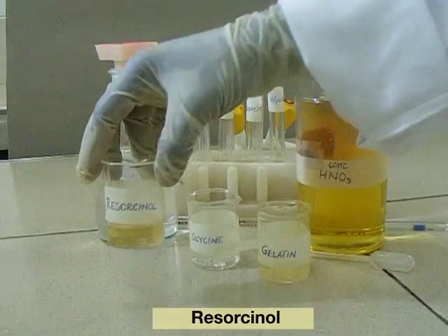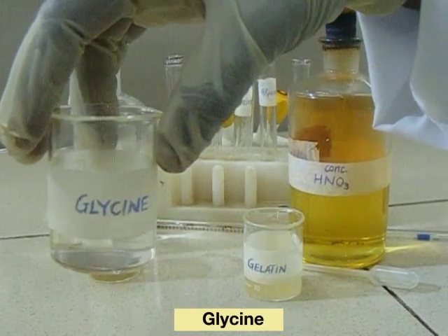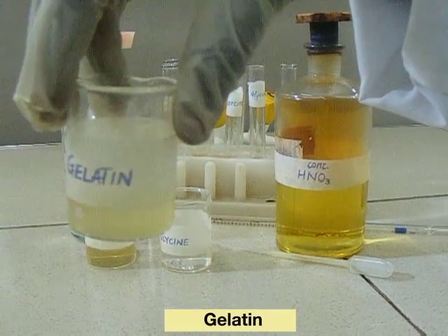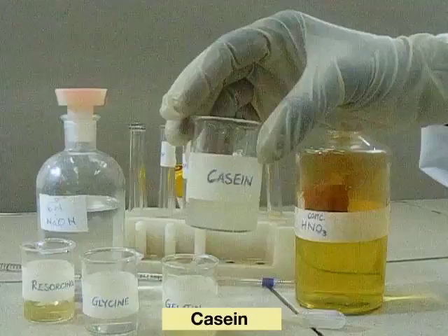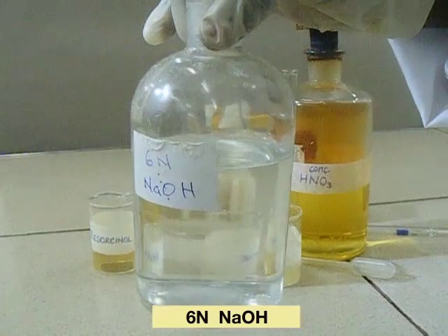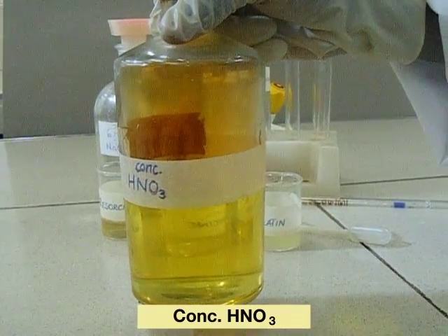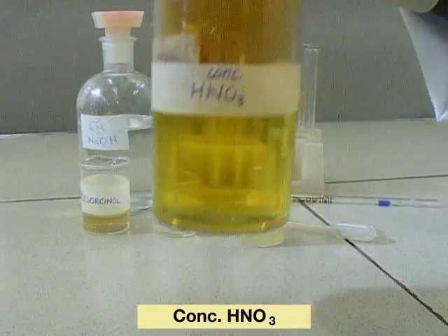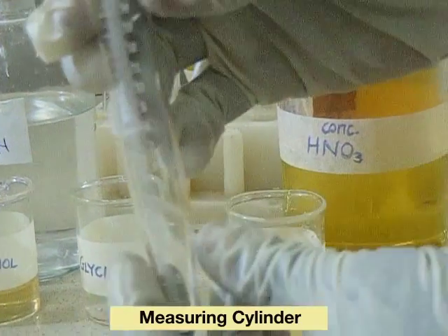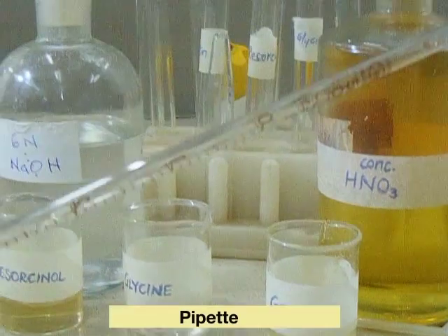The test materials used are resorcinol, glycine, gelatin, casein, 6-normal sodium hydroxide, concentrated nitric acid, test tubes, a measuring cylinder, and a pipette.